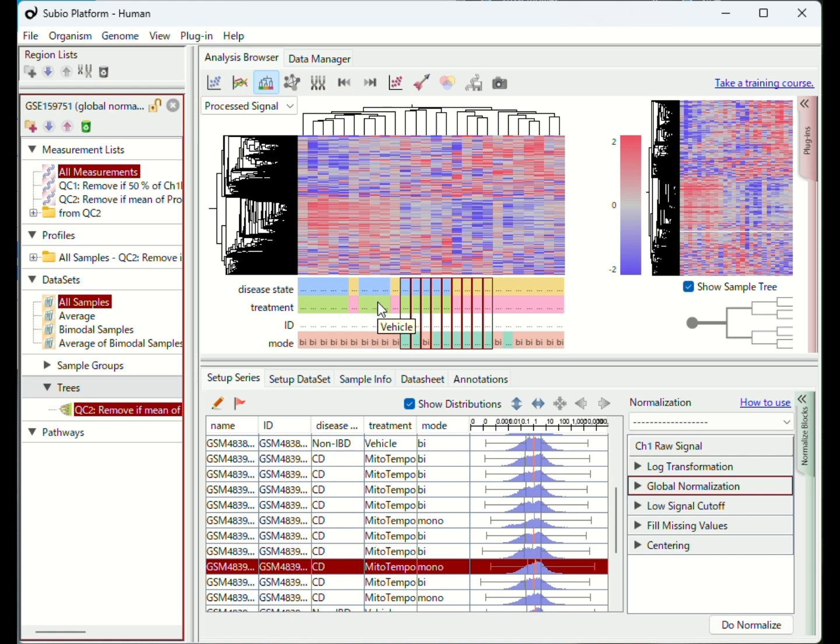The difference between CD and control is clearer when comparing only the high-quality, bimodal, samples. You see that monomodal subclusters introduce noise, disrupting differential expression analysis.